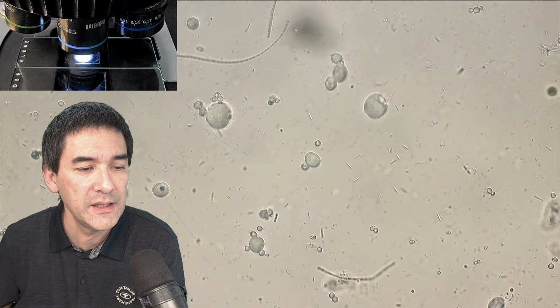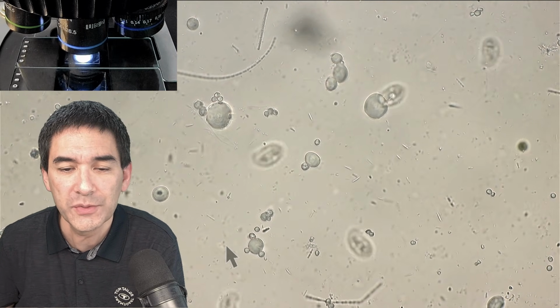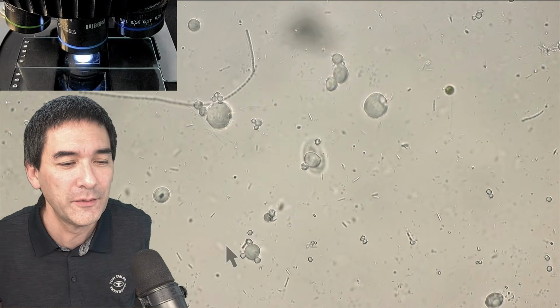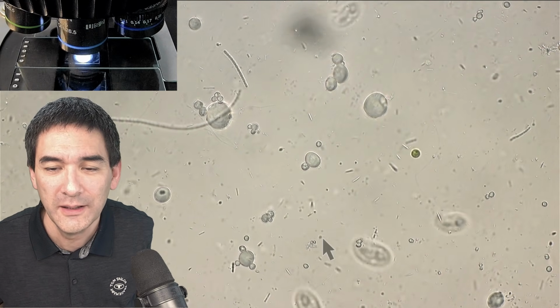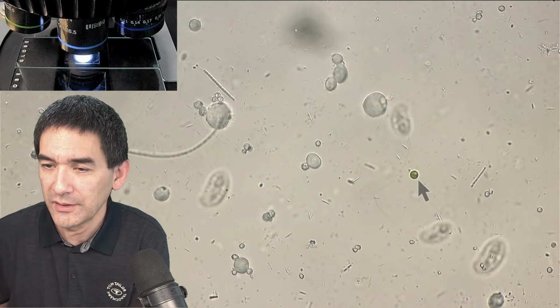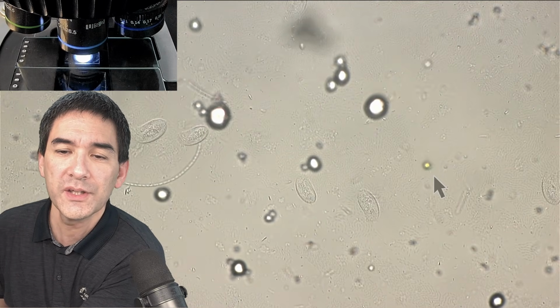And that is, I would like to quickly talk about the differences between prokaryotes and eukaryotes, because, that's the wrong one. I was accidentally moving myself now instead of the arrow. Where's the arrow? Here it is. Here we go. Okay. So what you see over here, those large ciliates, now they're a little bit blurry because they're out of focus. But that's fine.